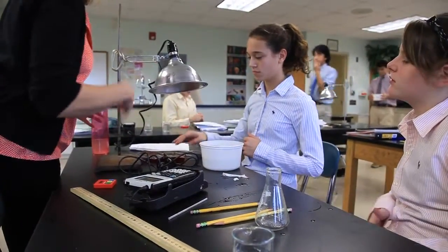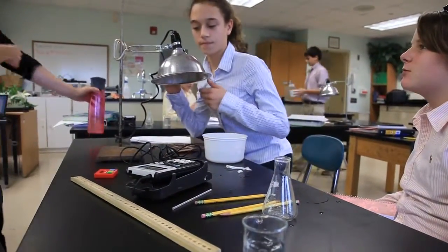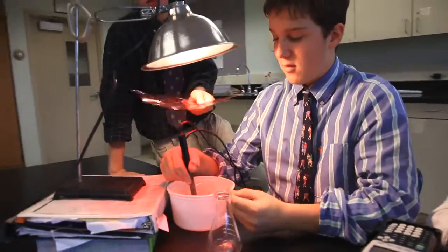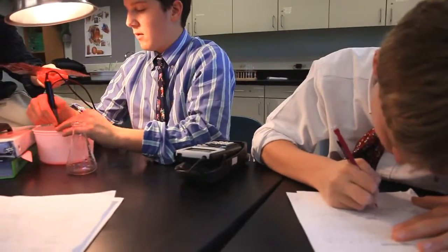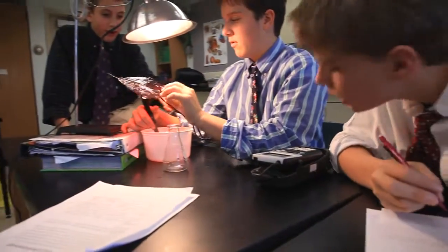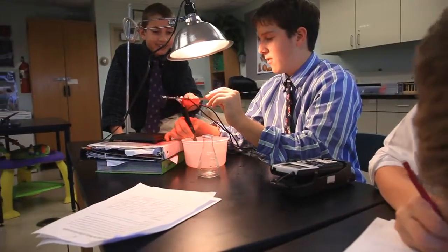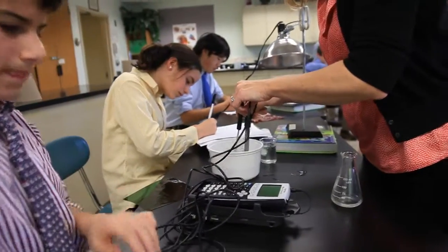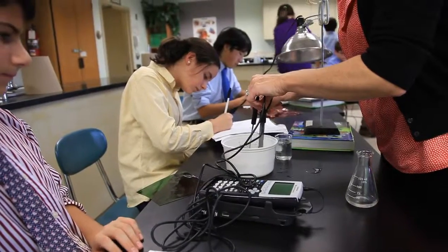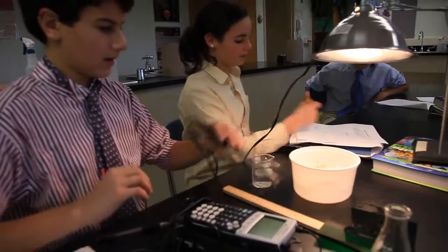And everything else about your setup from yesterday is the same. They already learned in class how photosynthesis works, but in lab they're really grappling with how it works in nature, how photosynthesis can be affected by different environmental situations. Right, control.